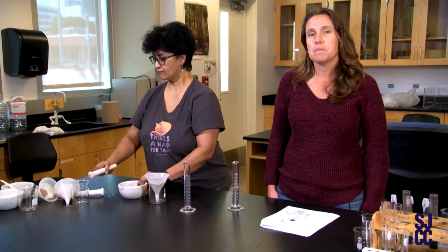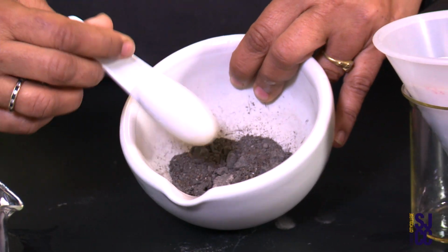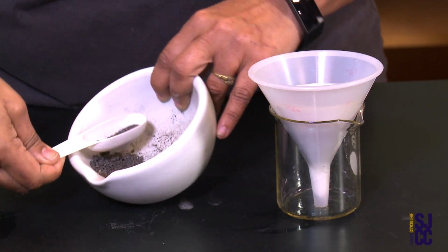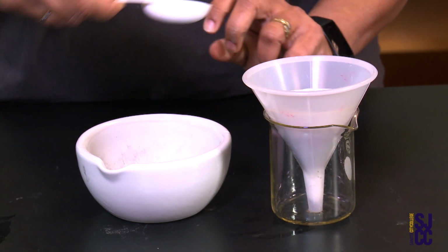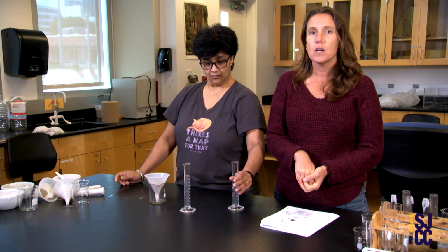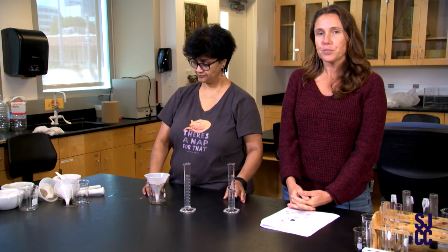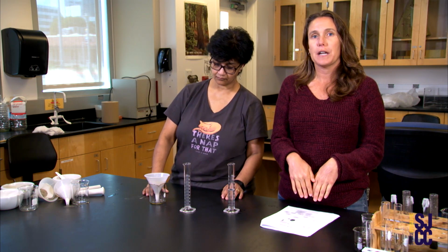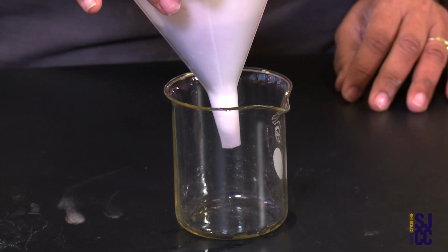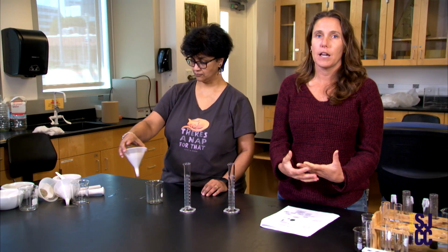And so again, we ground up our topsoil. It should be kind of in between the clay and the sand. Again, a wide range of our agricultural production depends on our topsoil. And we're going to, again, do the same procedure. We did 2 tablespoons in our mortar and pestle, and then we put it in the funnel system where we put water to basically percolate or infiltrate out. And we recorded the time, which should be in between the sand and clay for the leaching time, and then we measured how much water was retained in our topsoil.